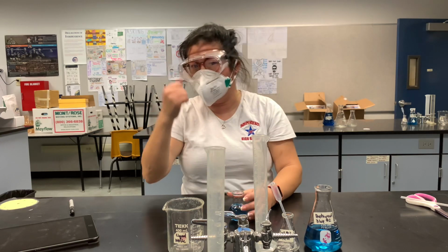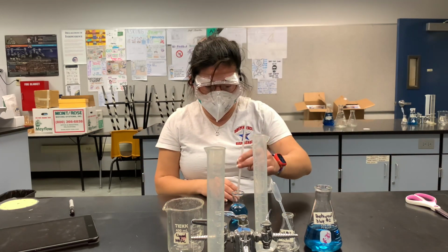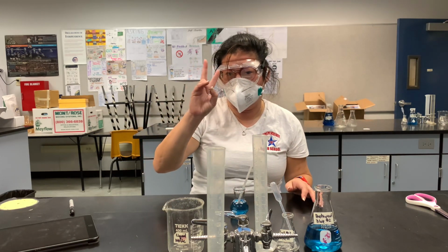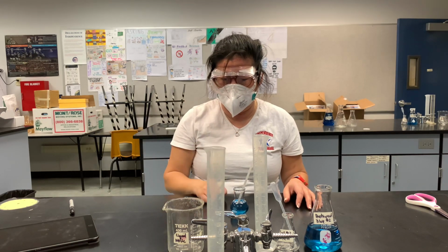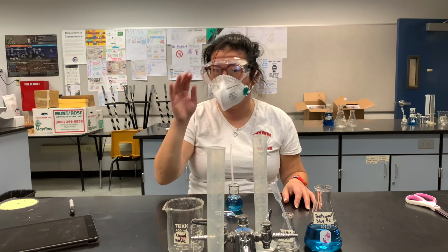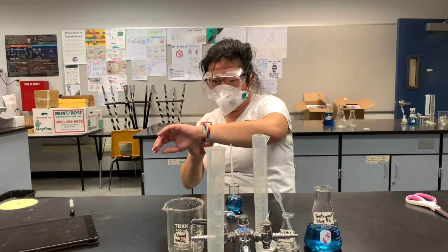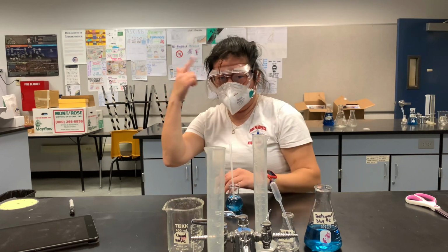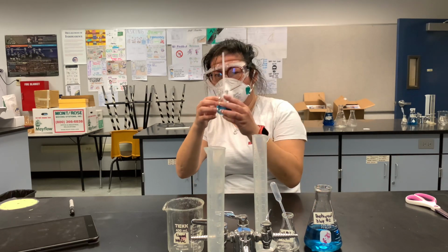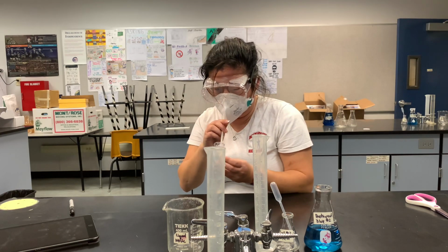We're going to add on in increments of 5 seconds of blowing. There should be 4 people in the lab, split into 2 pairs. Each pair, that means 2 people, you're going to have 2 jobs. One person is going to be blowing the solution, and you have to blow very gently. The second person is going to be a timer. Since I do not have a second person, I'm going to count to myself 5 seconds while I'm blowing. Now it's very important that you blow gently. If you don't, the water will come back up.